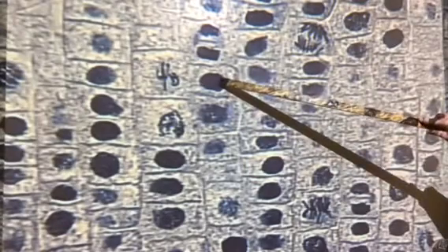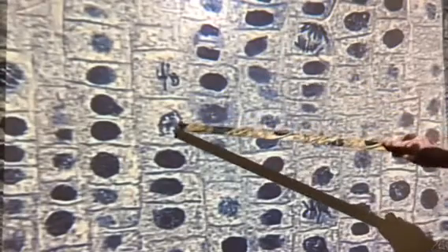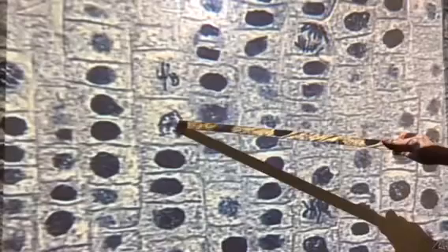So again, interphase, prophase, metaphase, anaphase, and telophase.